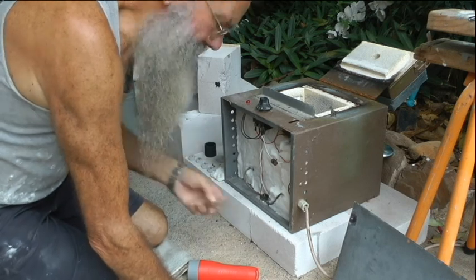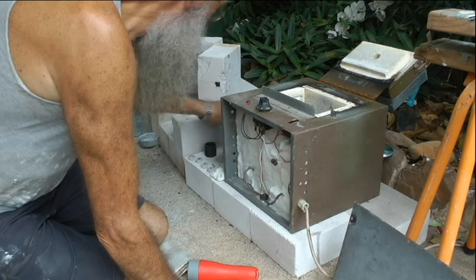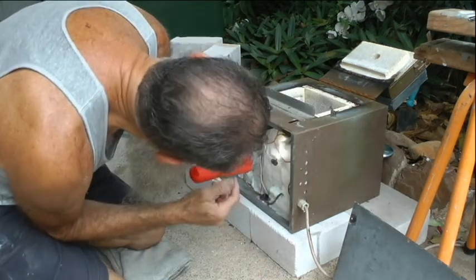I noticed a piece of that broke off again, and I had to rejoin that up. But I think it's something in the switch. The light's not coming on.